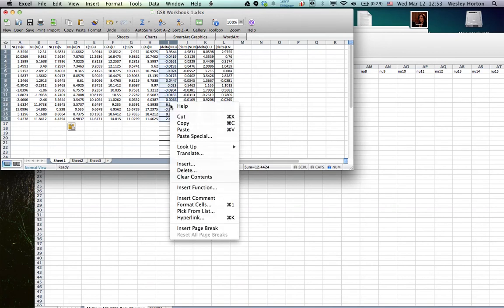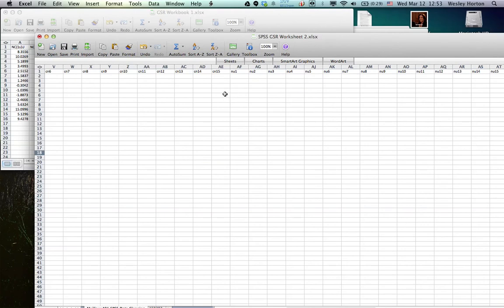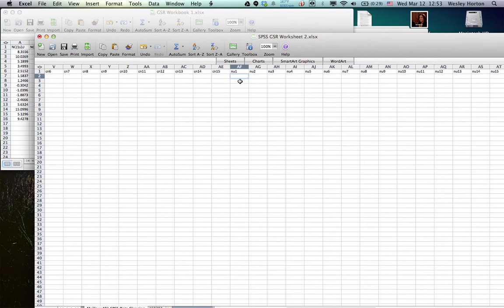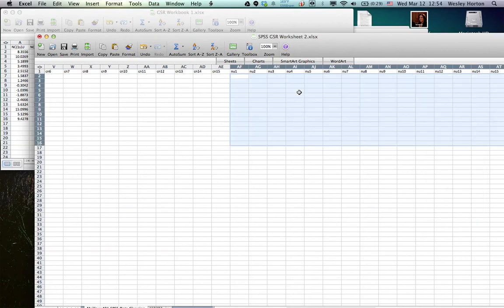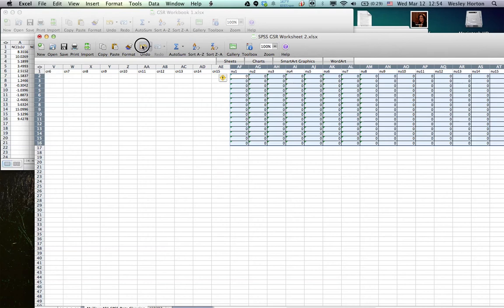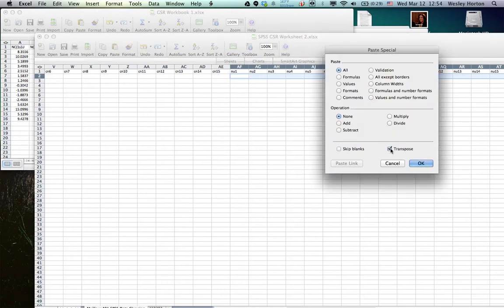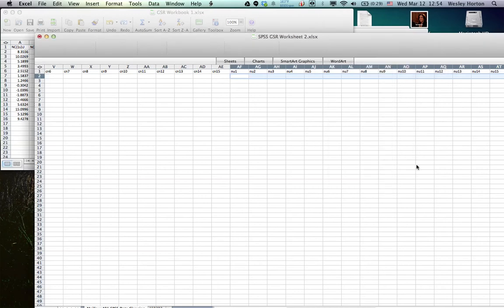So let's do it and copy that. So let's find non-SIBS unpleasant right here. It's going to start there. So we're going to paste as special, and we're going to change it to transpose, and we're going to do values only. Actually, we'll just select this 15 first. So we're going to select the 15. We're going to go paste special, transpose, and values. Make sure you do values or it'll give you just the end formulas. So that's the purpose of that. So all of our scores are there now.